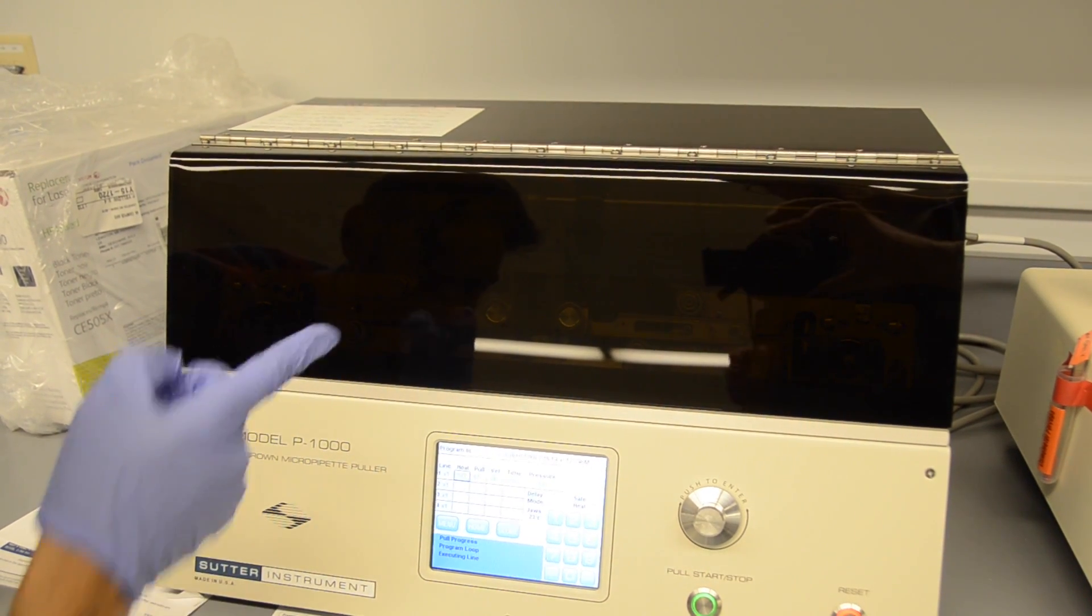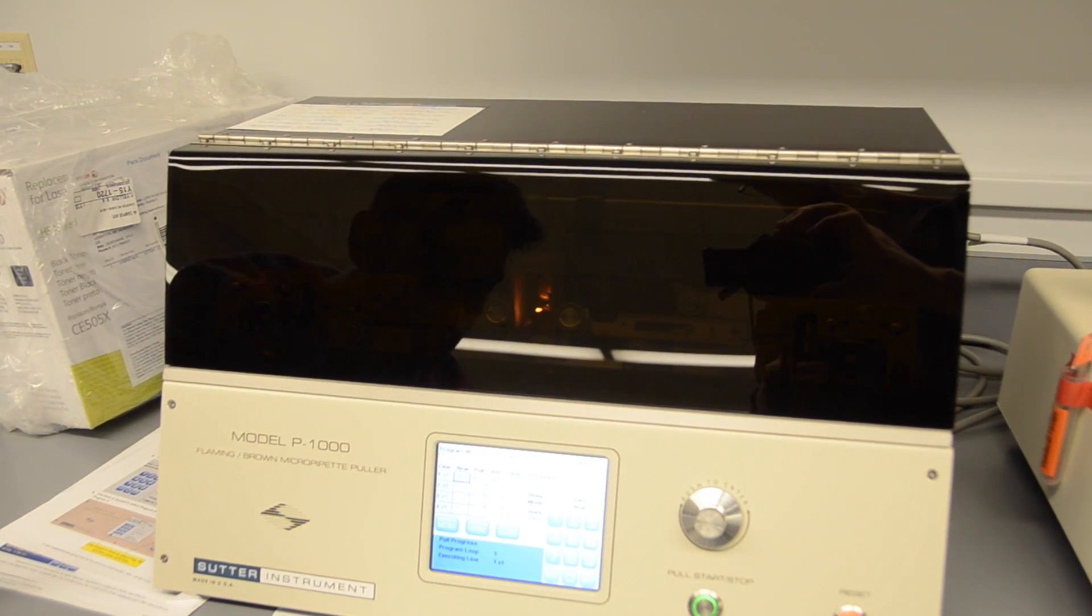You just want to zoom in into the box. You see the filament. And then it's going to pull. And then it's pulled.